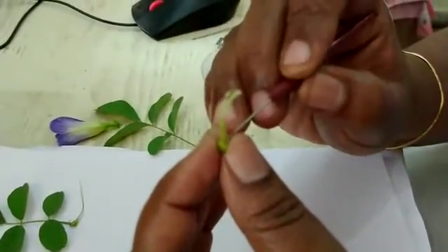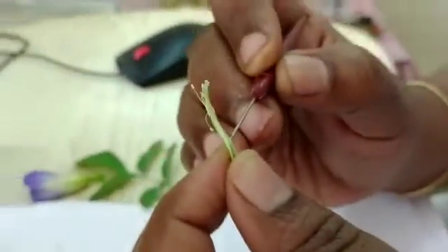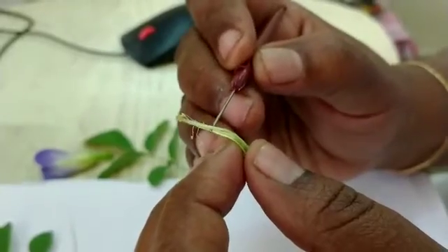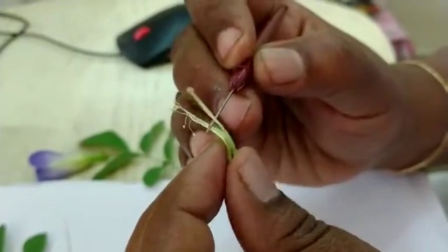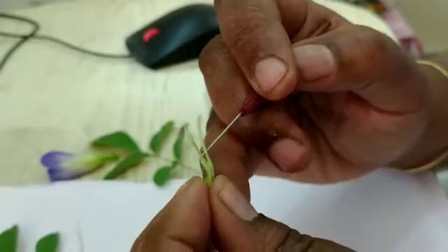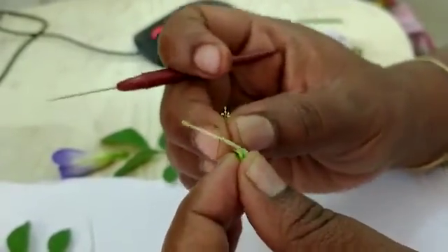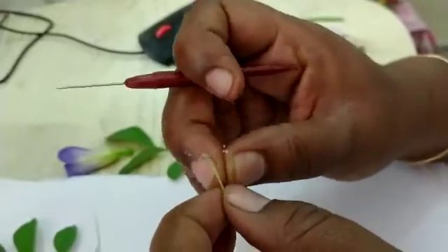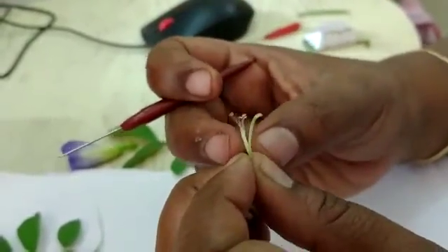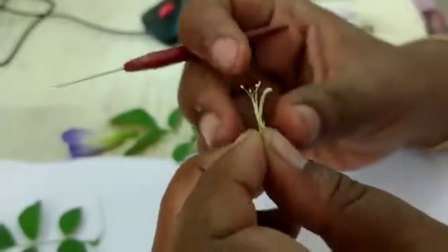I am removing the single stamen and keeping it aside. Taking out the remaining nine — you can see the nine stamens united. In the middle, we can see the gynoecium. The nine stamens are united like this, showing the diadelphous condition.